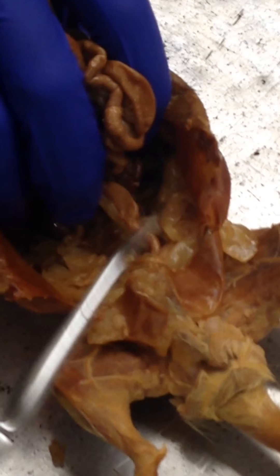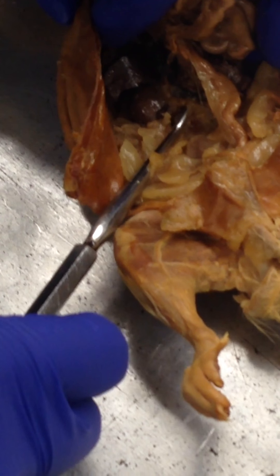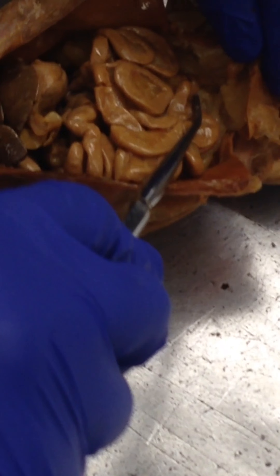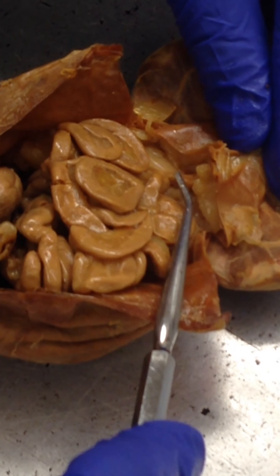We struggled a little to find the ureter and we're not absolutely sure, but according to our reference, it might be this structure right here, though we're not entirely sure on that one. The bladder is going to be right under here — this is a female specimen. Here is the bladder.